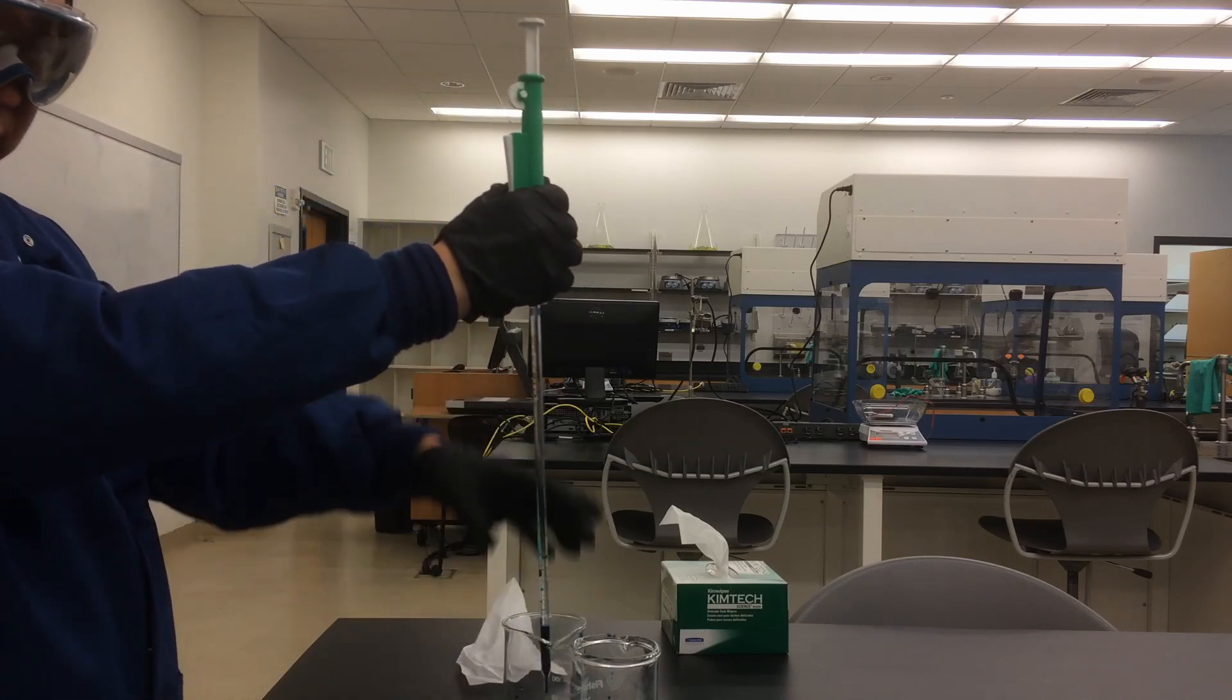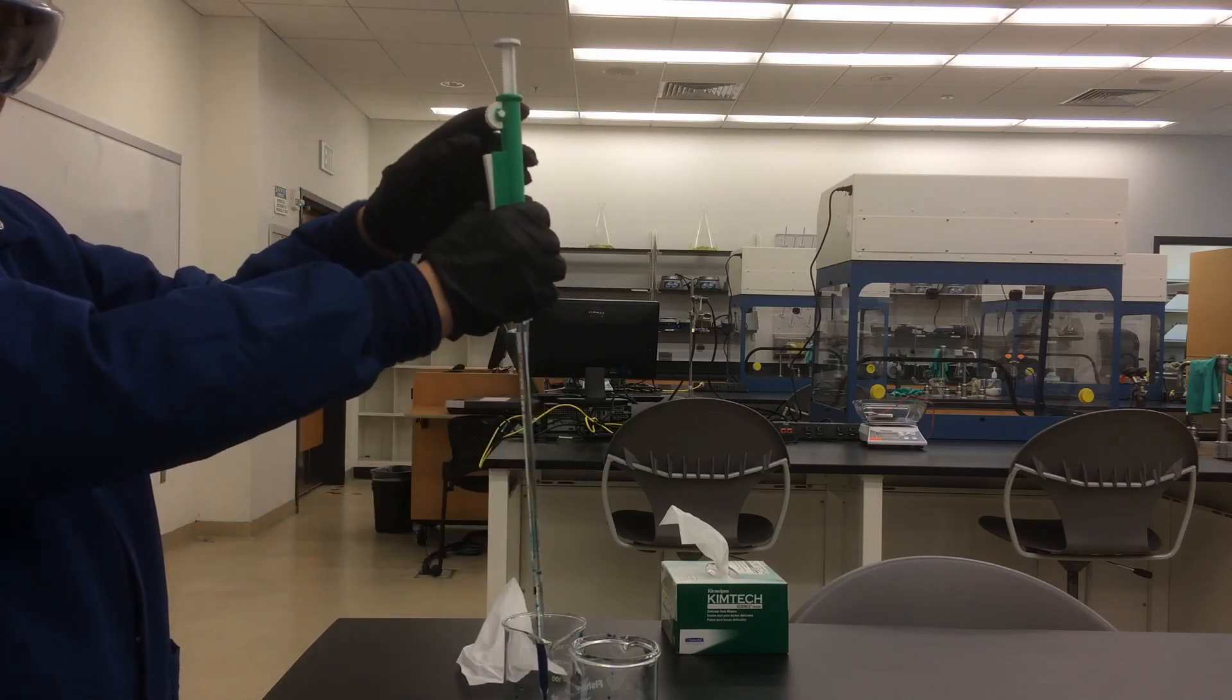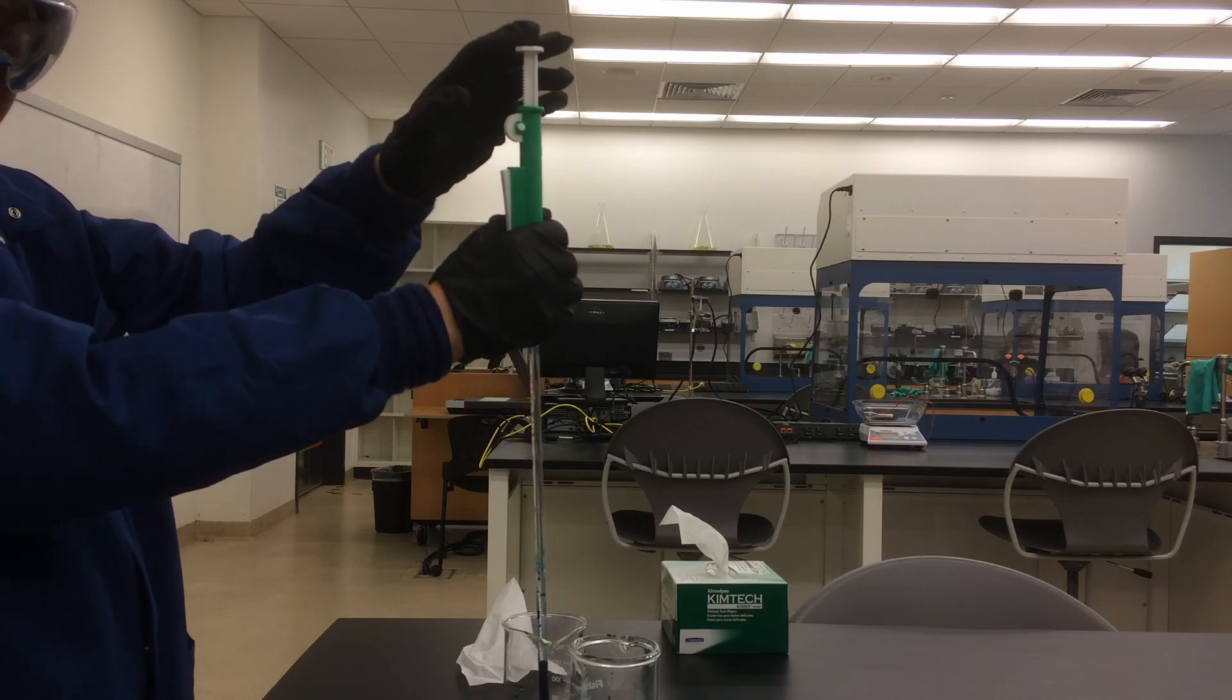At this time, you never want to drain the solution using the top of the pump here.